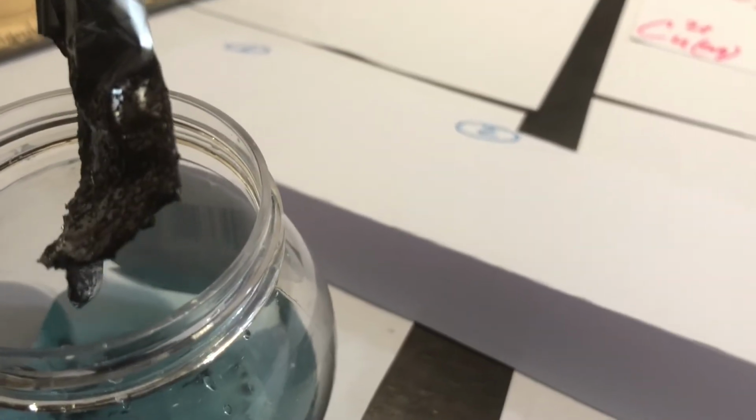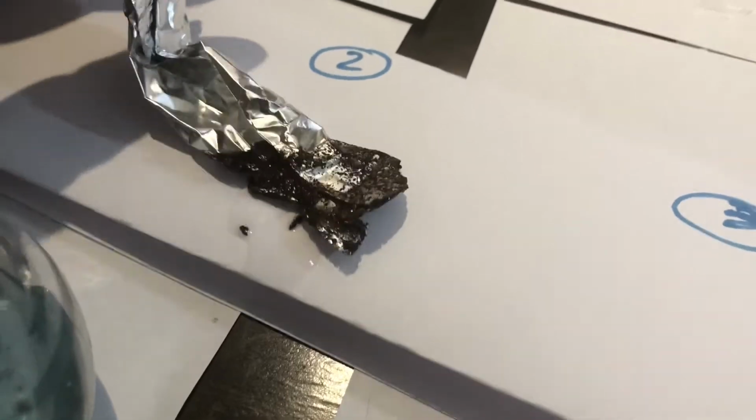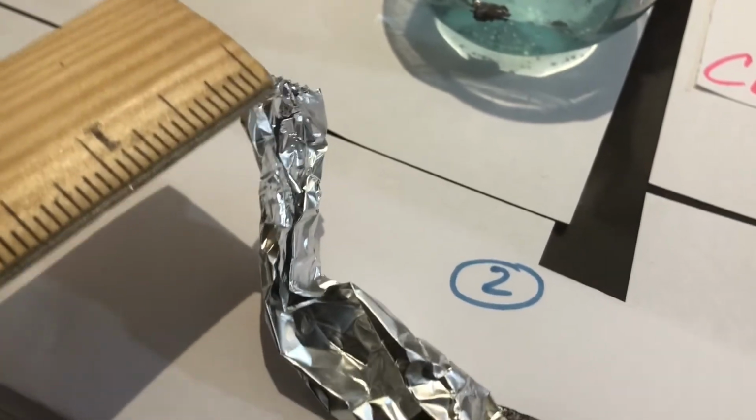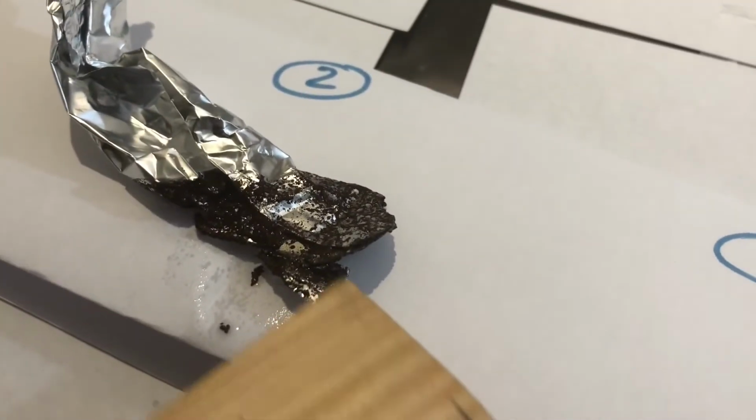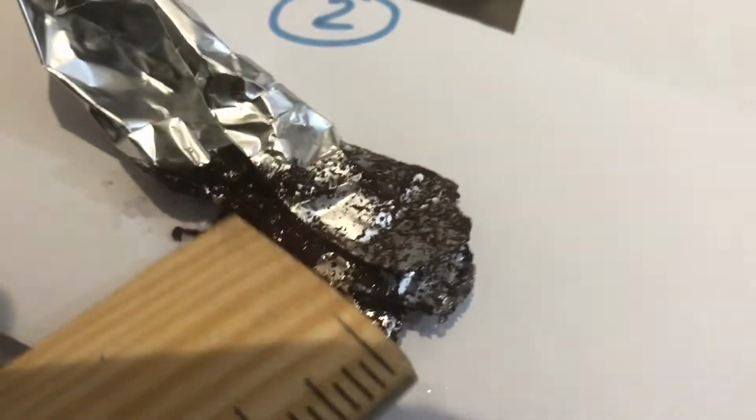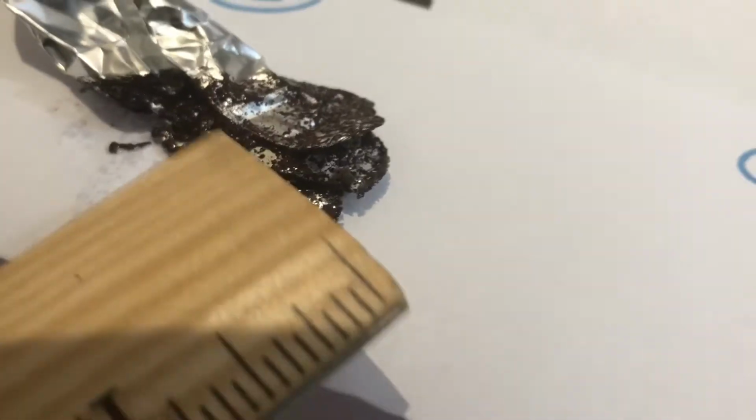Looks like a mossy kind of dark stuff right there. That stuff, folks, is copper. So this reaction definitely took place. Let me take the piece of aluminum metal out, and I'll put it right here. Let's look at it carefully. Now look at the difference, folks, between this side and the bottom right here, which was in contact with the copper ions, as opposed to the top part that wasn't in contact with it. We see a definite color change and production of new material, right? That dark mossy looking stuff right there is copper.